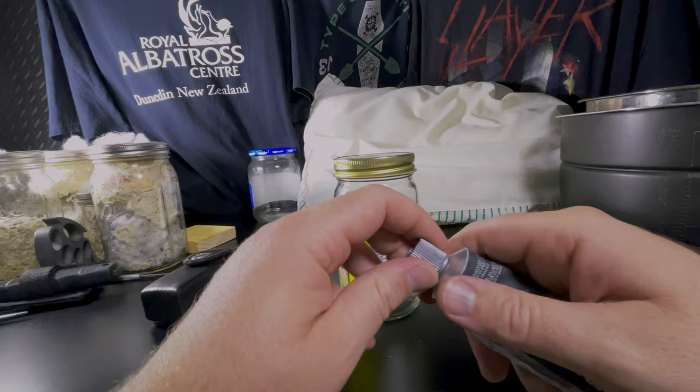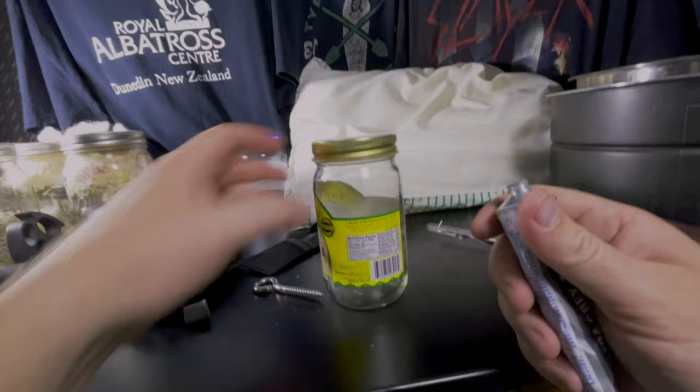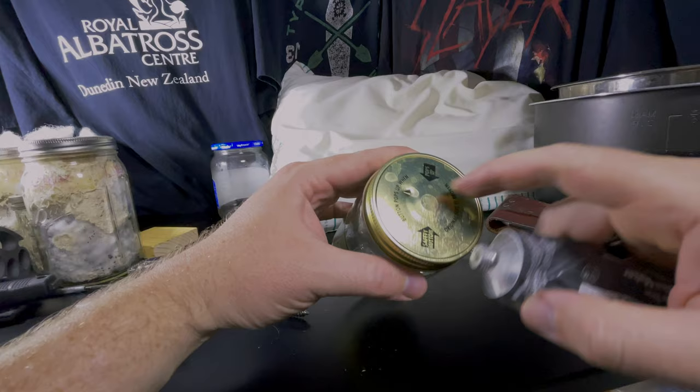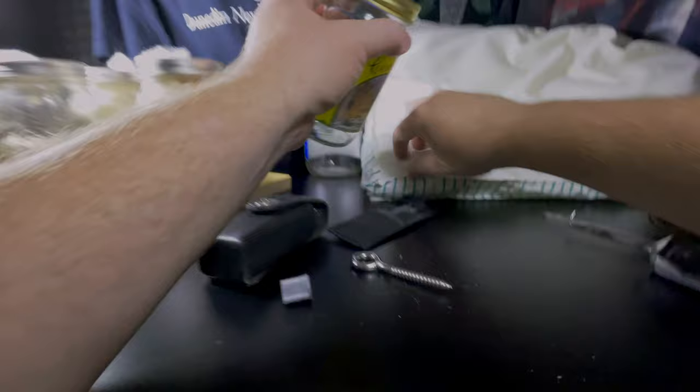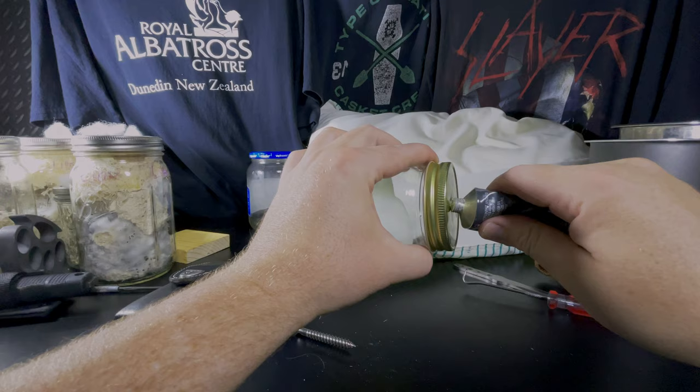So next, all we have to do on our jar where we stab the lid. So let's use the smaller one for injection, so that it's more likely to not become an issue, and the larger one will be for stuffing. Ideally, you would clean this surface really well. We'll just do it with what we've got right here. Put a bump of this on here.